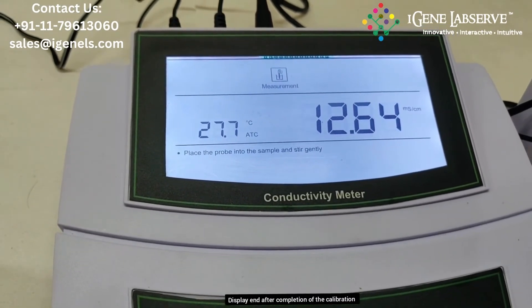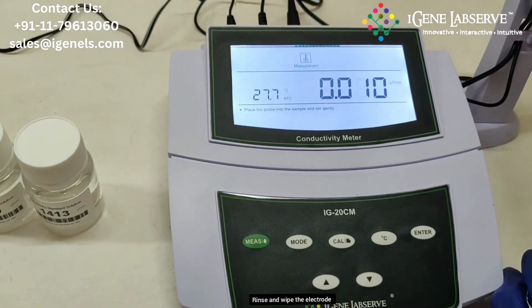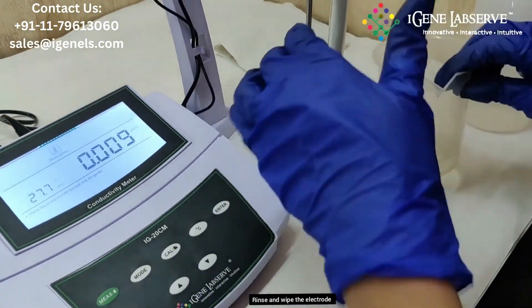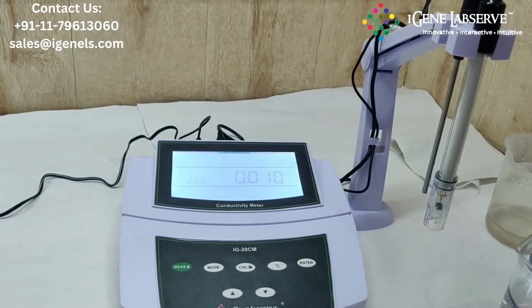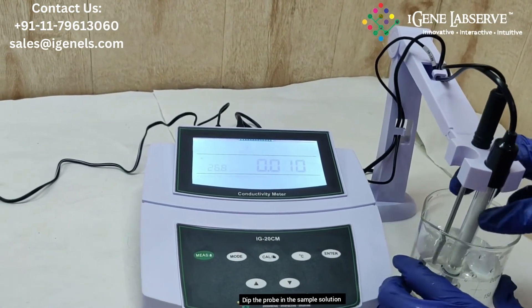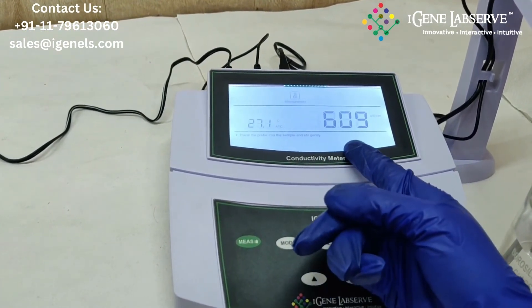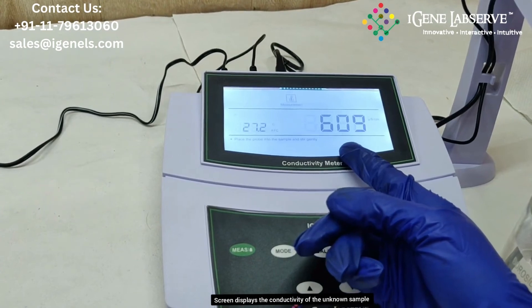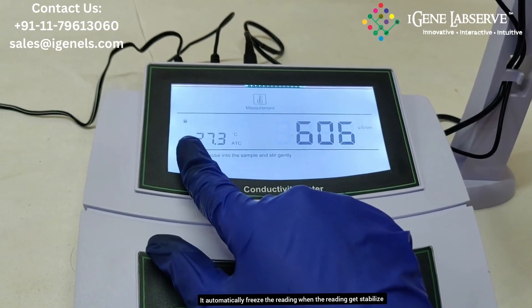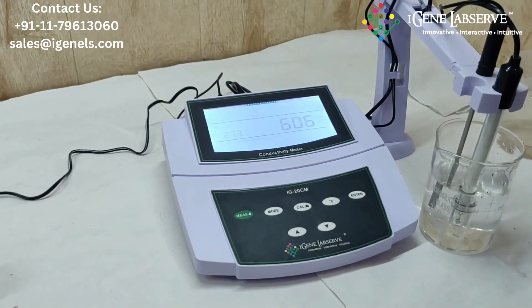As calibration is completed, it displays 'end' and goes back to measurement mode. Remove the electrode, wash and wipe it again, then place the sample solution and dip the electrode in it. Press the measure button to release the readings — it shows the conductivity of the sample solution and automatically freezes the readings when they stabilize. This is how iGene's conductivity meter works.